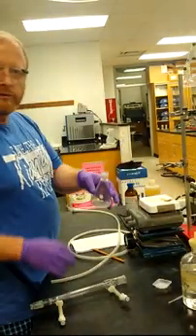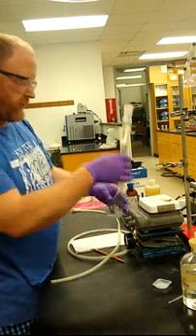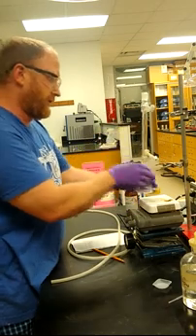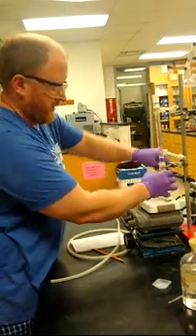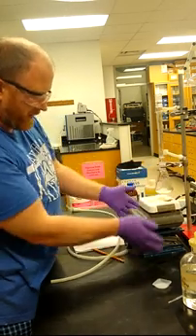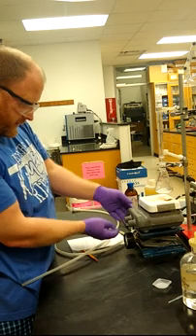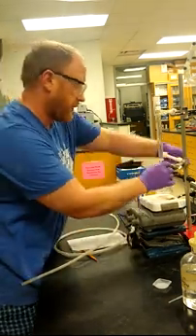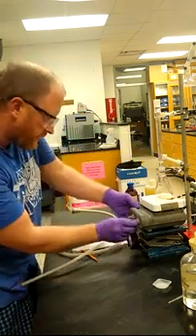After having added all of our reactants, we're just going to set this up for reflux. We've got our condenser and we're clamping that down. You'll see we've got our hot plate and our lab jack jacked up a little bit.